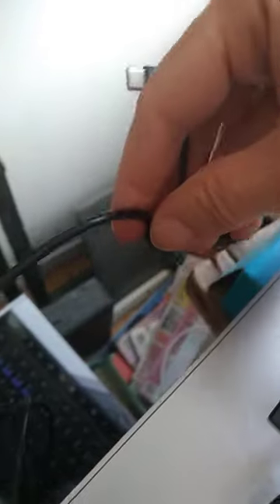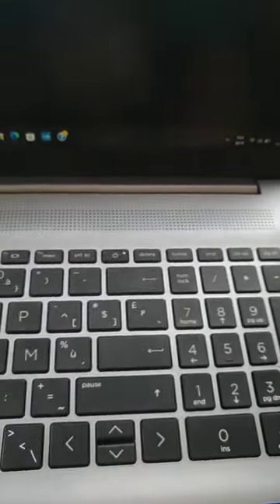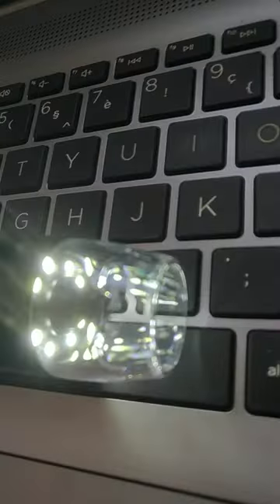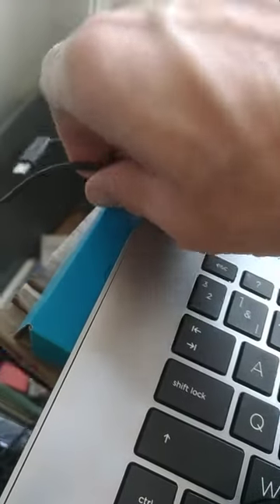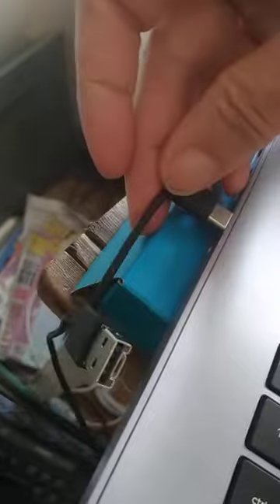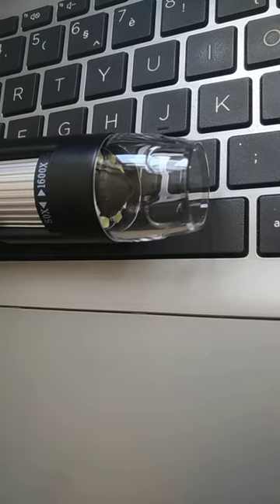Same thing. First, the regular USB. Okay, so there it is, and even here the computer made its little ding to say it recognized the USB device. Okay, and so now I'll switch to the USB-C. Here we go. Okay, you see it's the same one, and it's not working. Okay, I think that's pretty convincing.